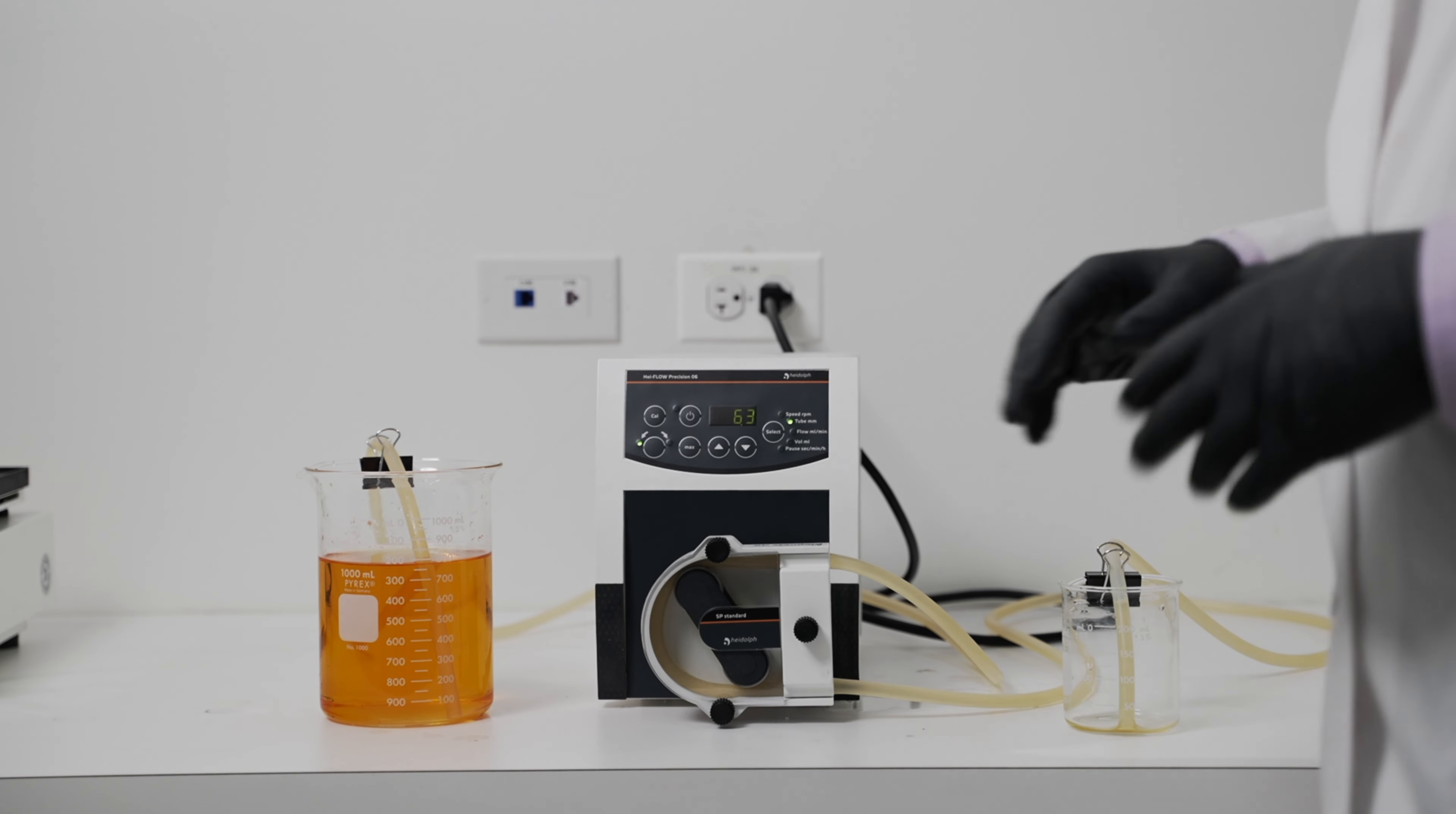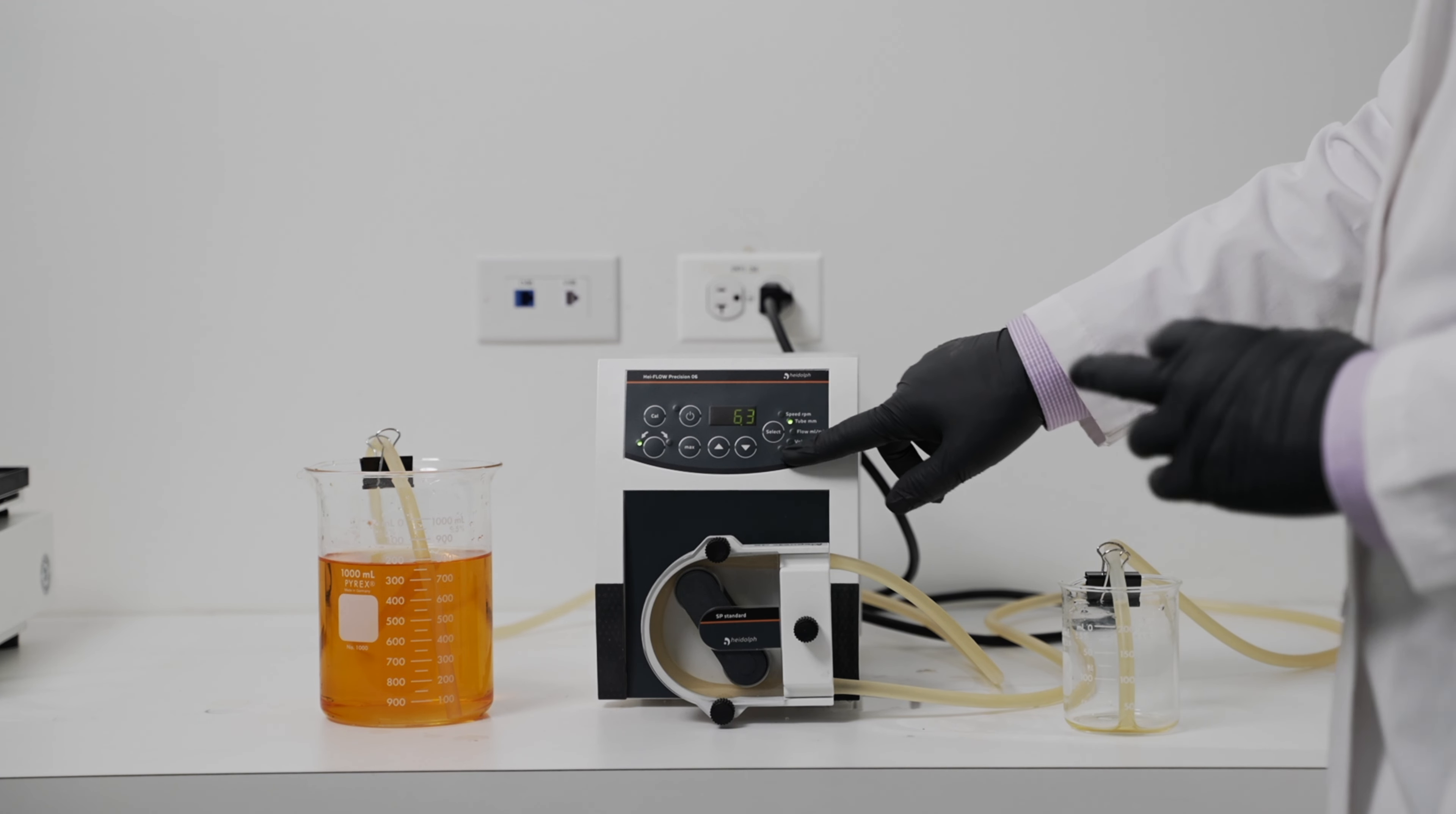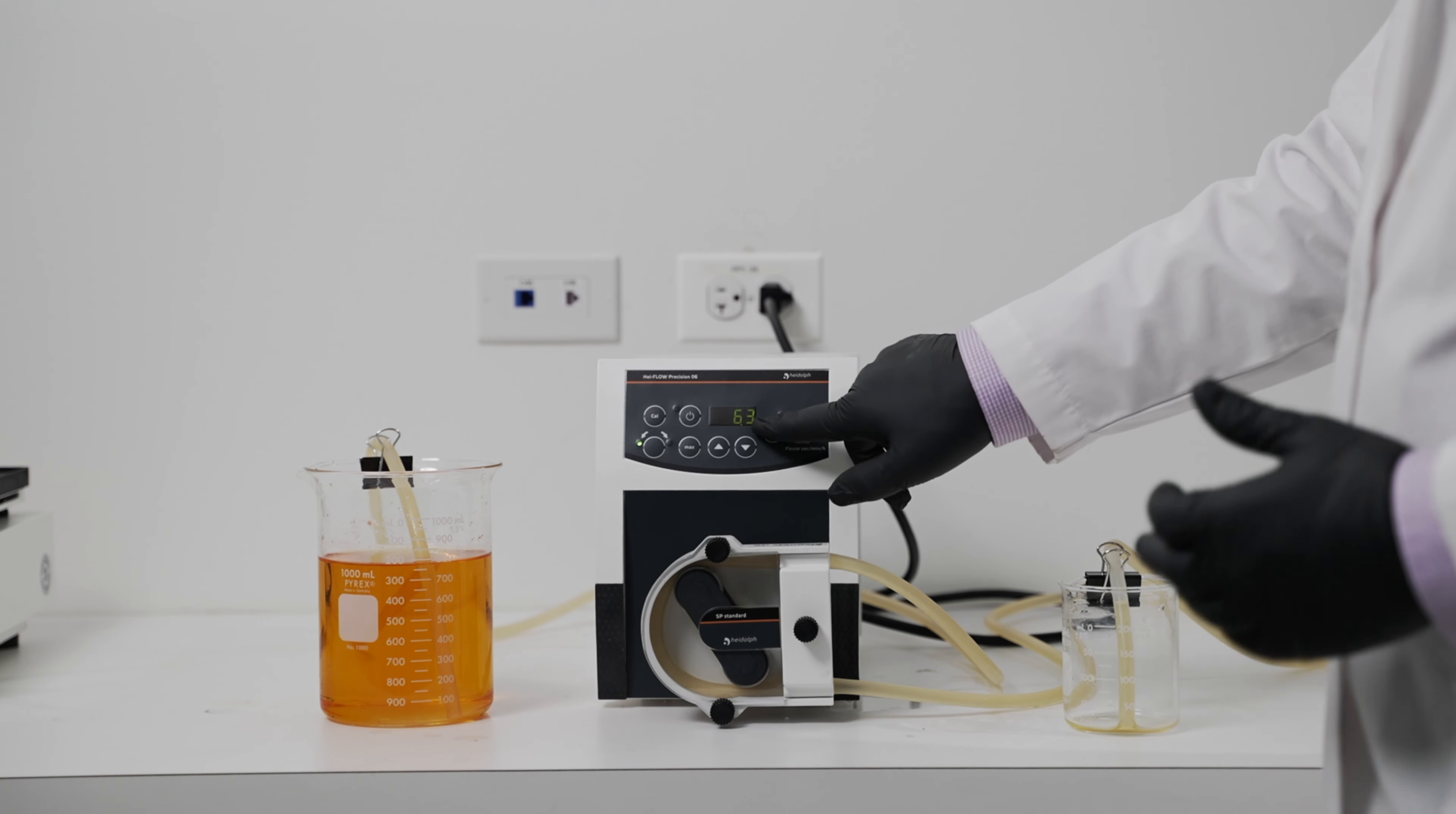Once those two conditions have been met, we can calibrate properly. There are two ways to calibrate, either by the flow rate or by volume. Volume is generally easier.